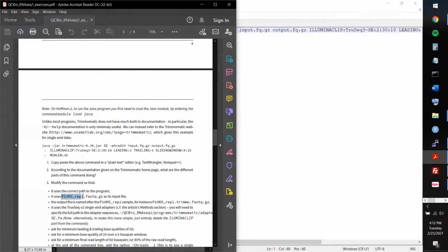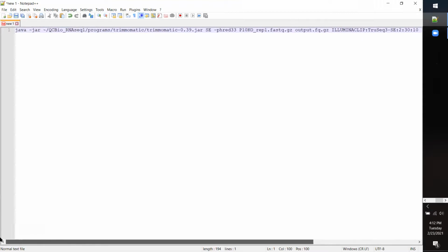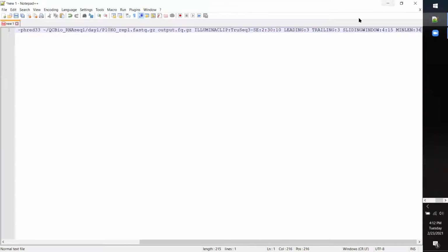And then I had to put this in as the correct input file. So I'm just hitting Control-C on there. But this also needs a bit of a change to the directory. So I had to put this in here, and then day one as the correct folder. And then I think I could just specifically set the output to the thing. I just picked the one that you recommended as a file name, but I guess you could choose anything here.